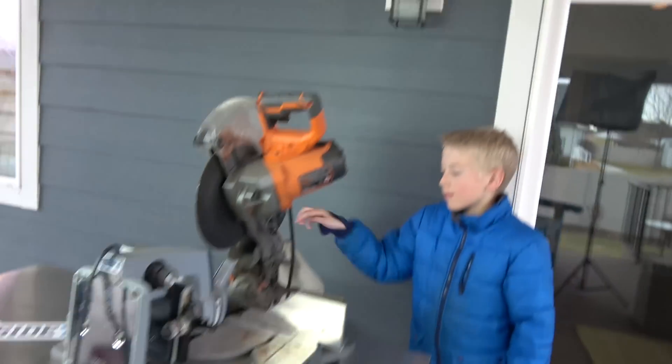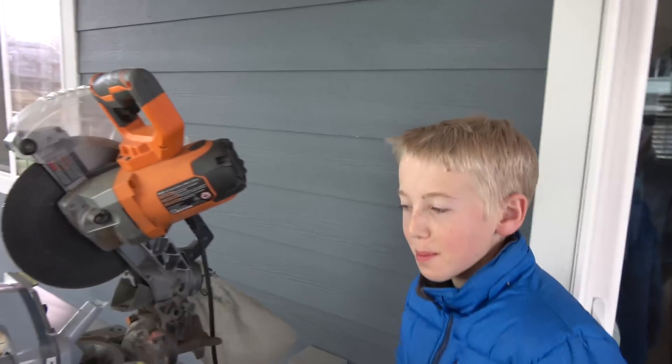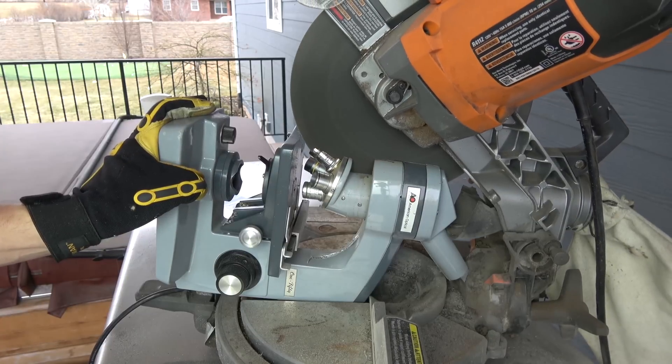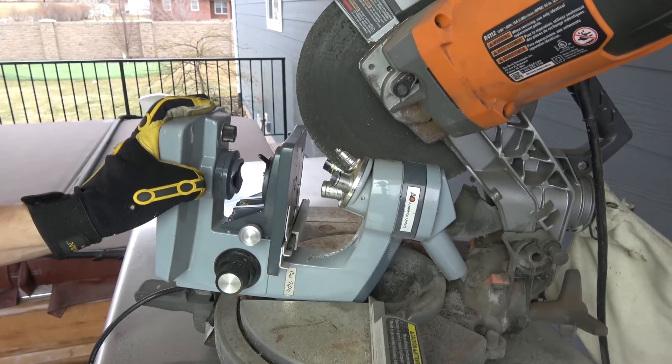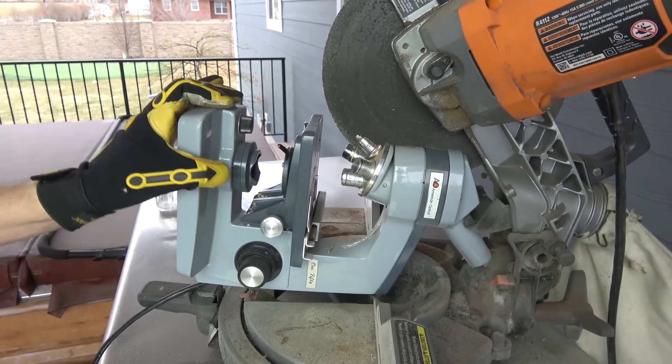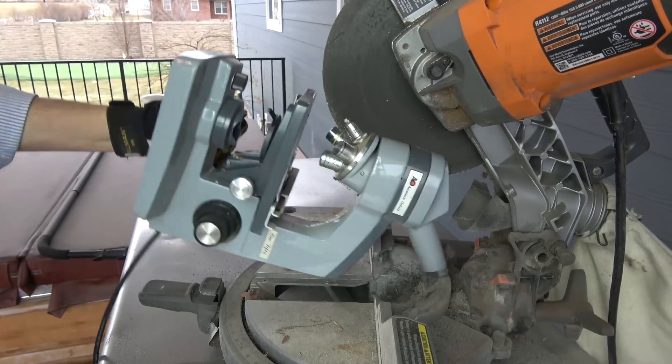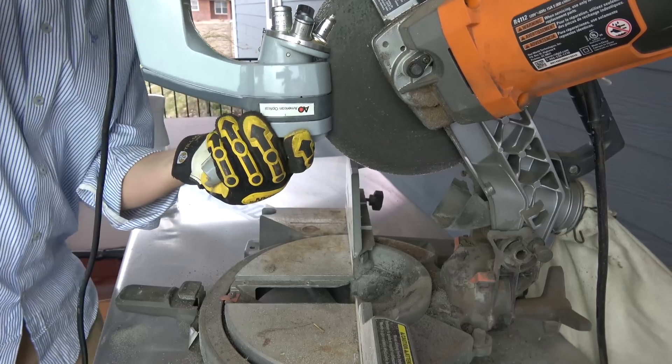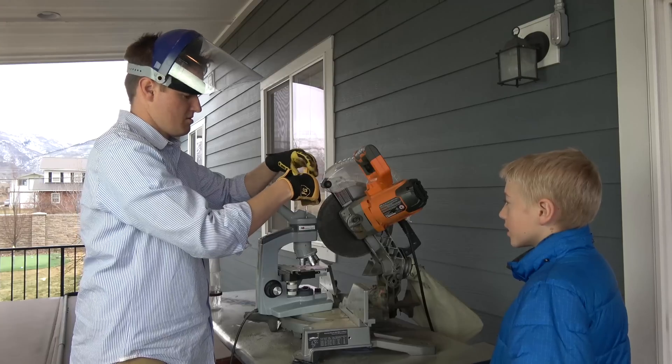That's hot. Hot metal. That was just for a lesson for the kids. Don't touch that. Don't touch hot metal. That's why you wear gloves. Okay, they are joined together.